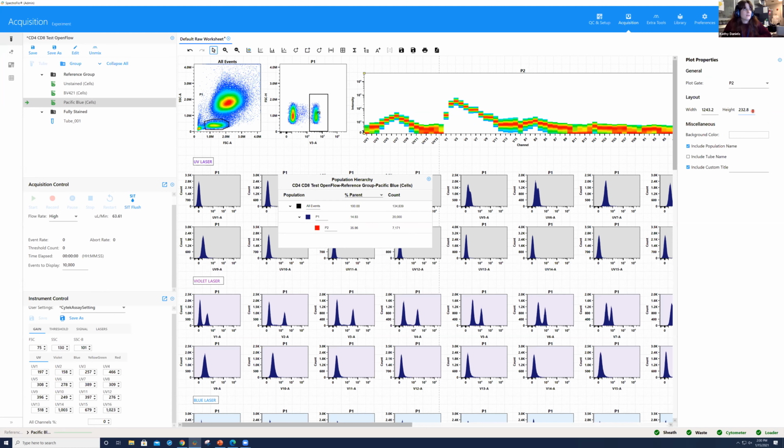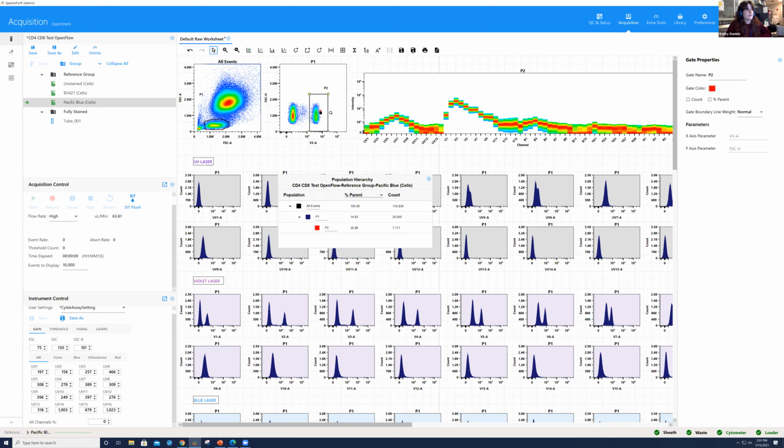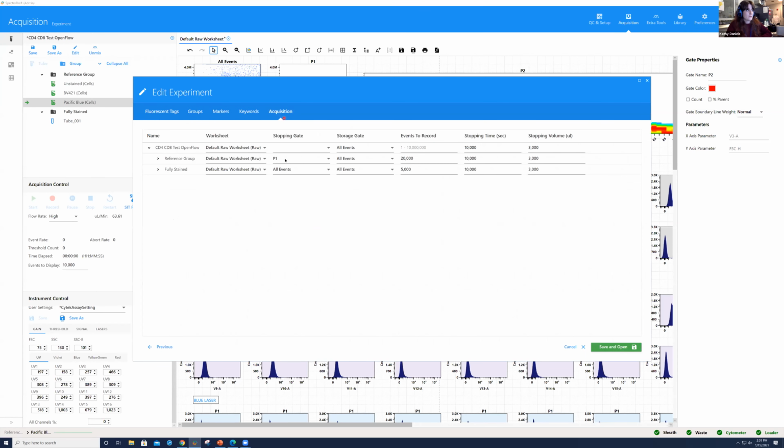Yeah, exactly. And if you're using cells as single color controls, and we go back to that question about how many is enough, if you have a gated population and you look at the detector where the signal should be the brightest, you can go back and edit this experiment, go into acquisition, and with that gate that you just created, make sure that you're recording at least that minimum of 400 to 1,000 if it's something rare, so that you know that you have enough. And then when you go in to do the unmixing, you can set the gate with the understanding that you really know where that is based on the unstained, and you can kind of help yourself out there.